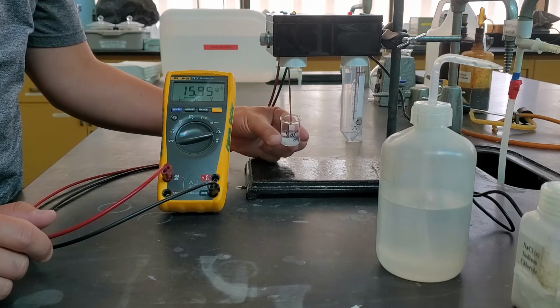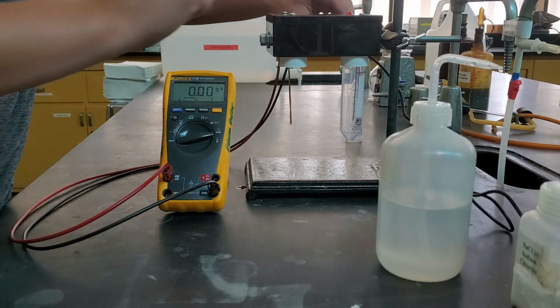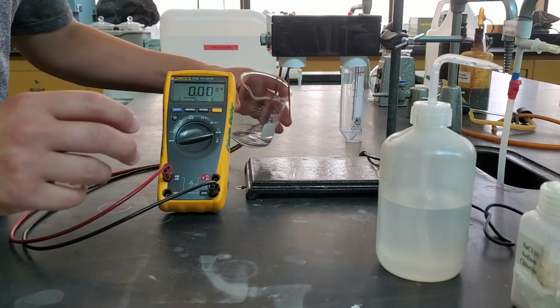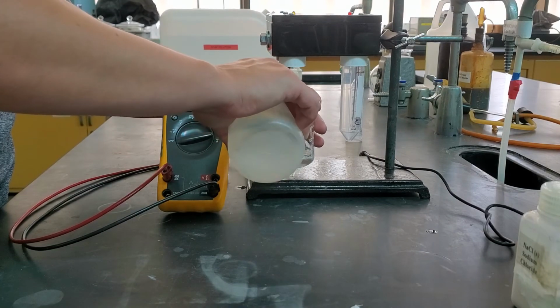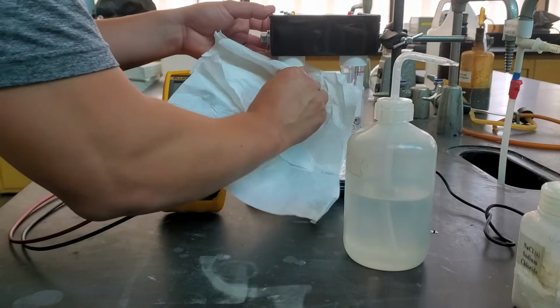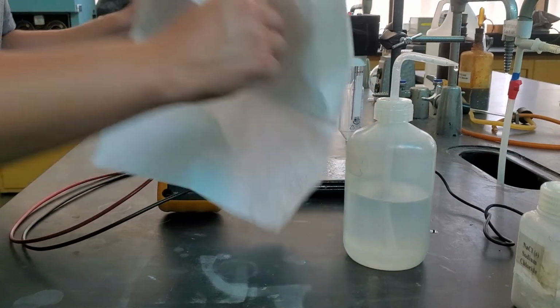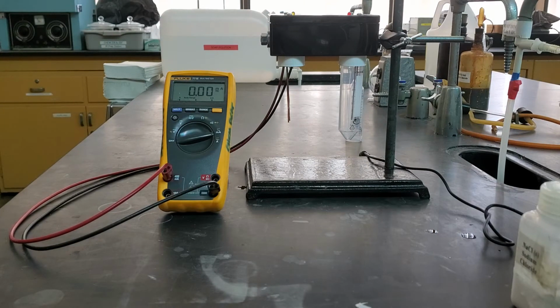So that was our salt that's aqueous, the solution version of salt, AQ afterwards. You want to make sure you get those in the right place. If it's got an S afterwards, that's just when it's a solid. If it's AQ, that means it's a mixture, and that means that it's mixed with water in this case. And so we use our deionized water.